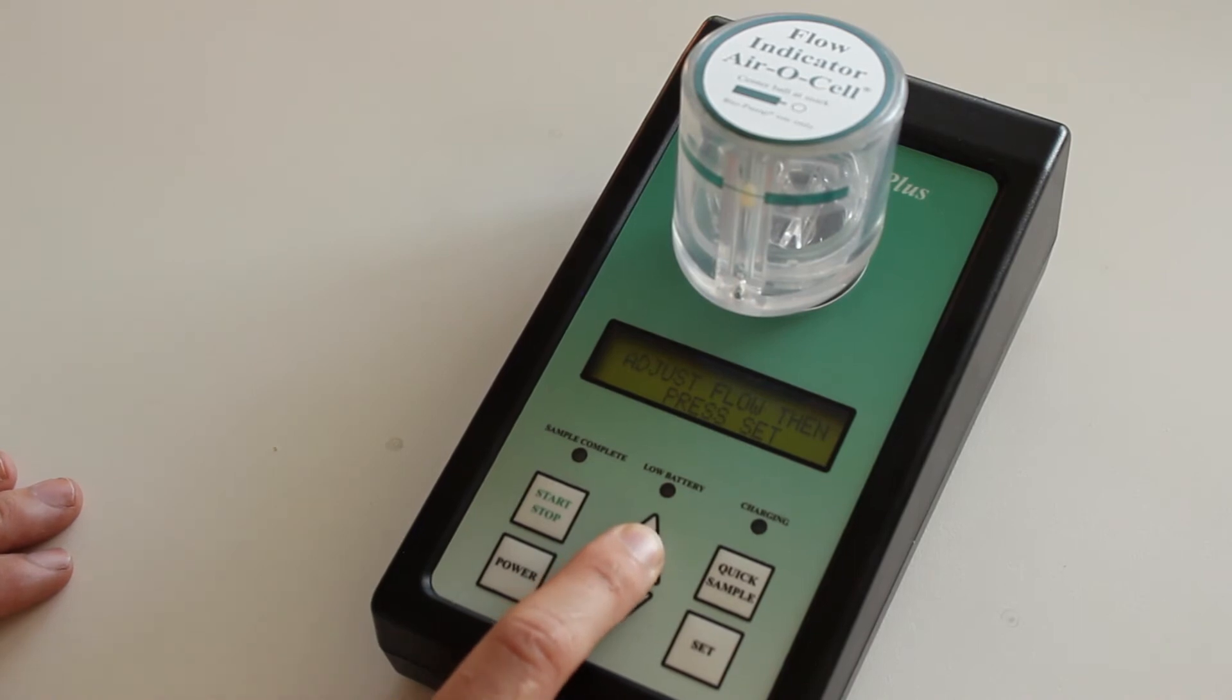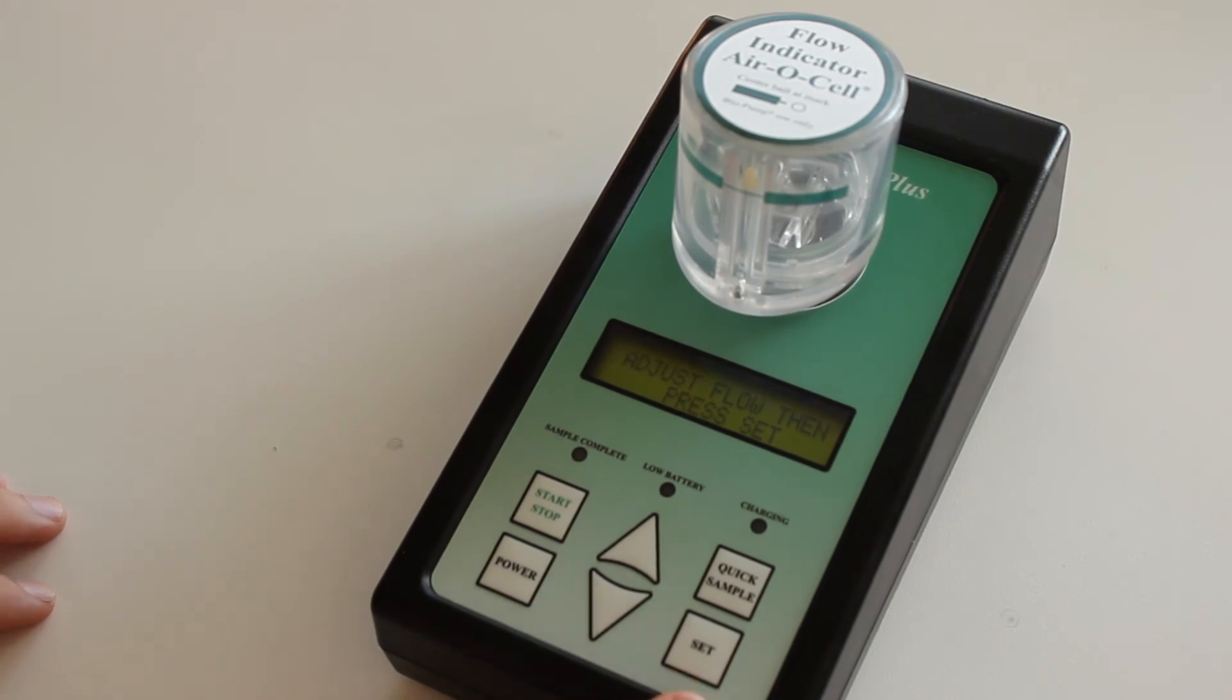What you want to do is make sure that it's stable with the ball in the center of that line. Once you're happy with it, you then press the set button.